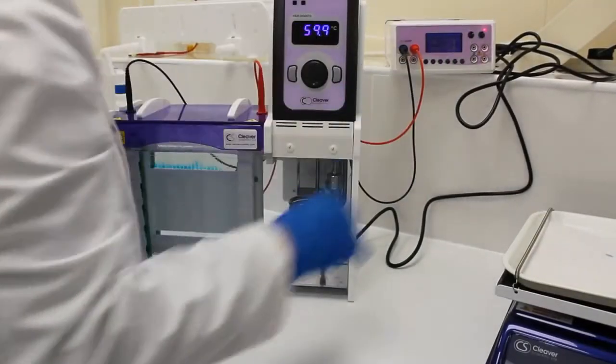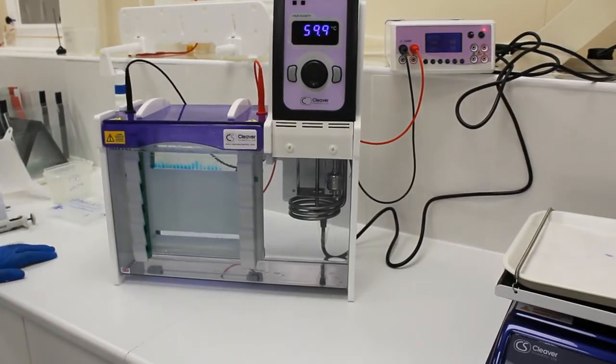Now we've set our power pack up. We're going to press start and then we're going to leave our gel to run overnight.